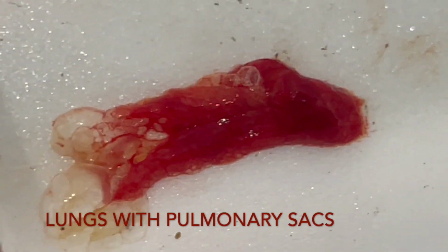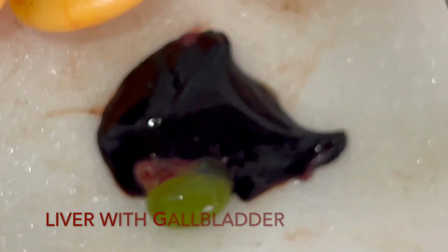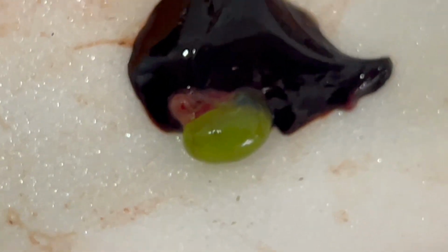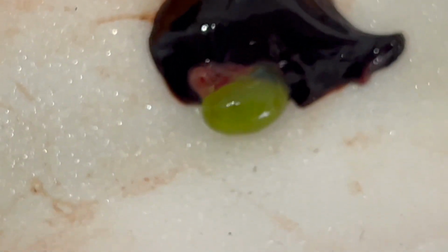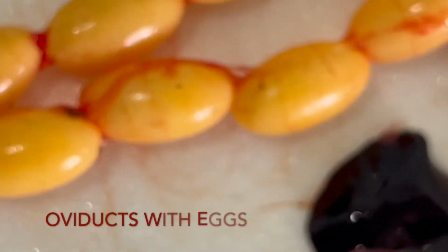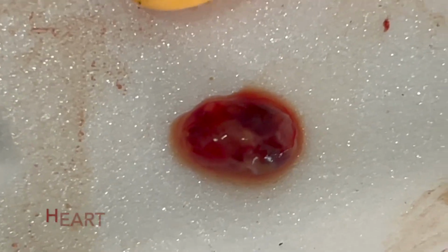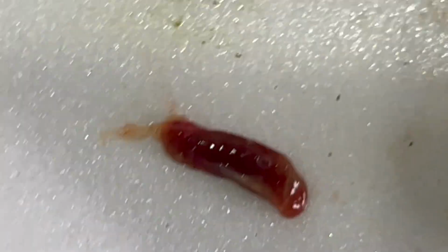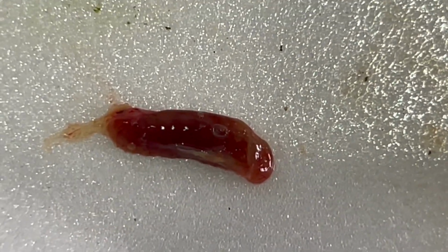Here, this is the lungs, here a liver with a wonderful gallbladder full of bile, here the eggs in the oviduct, here the heart, and here the kidneys of a chameleon.